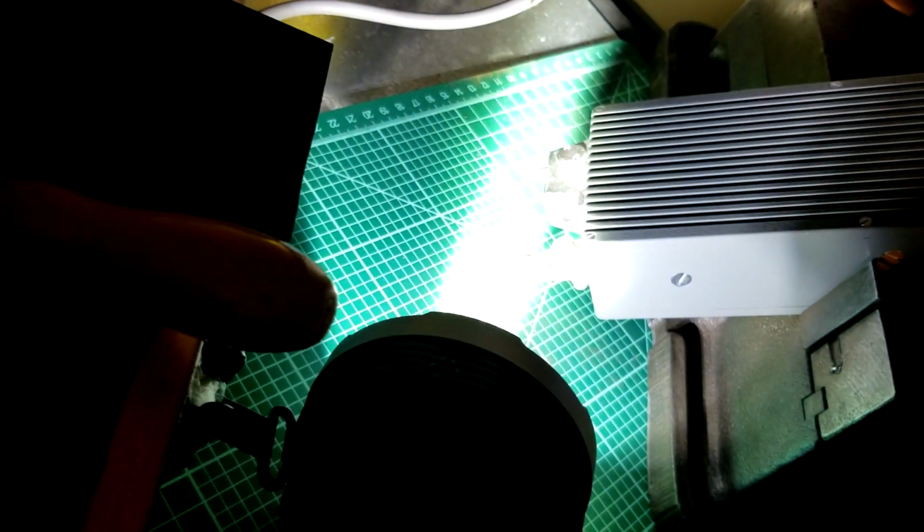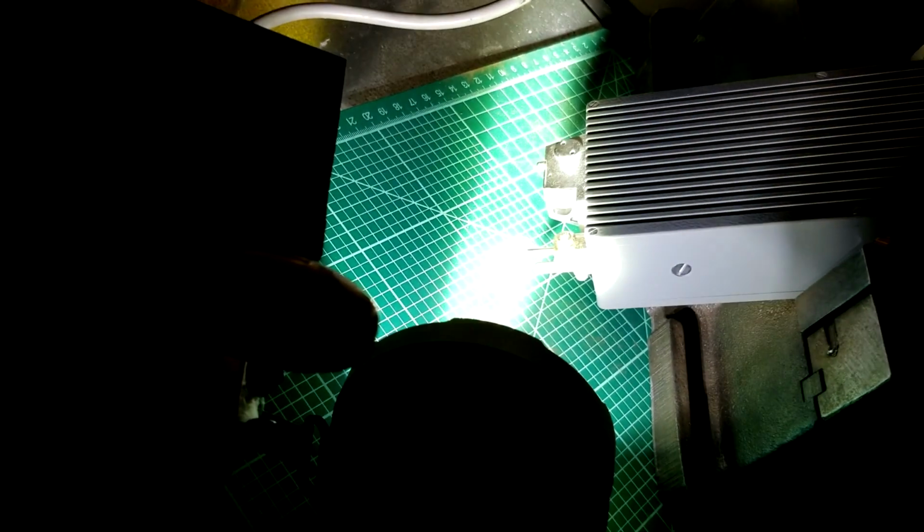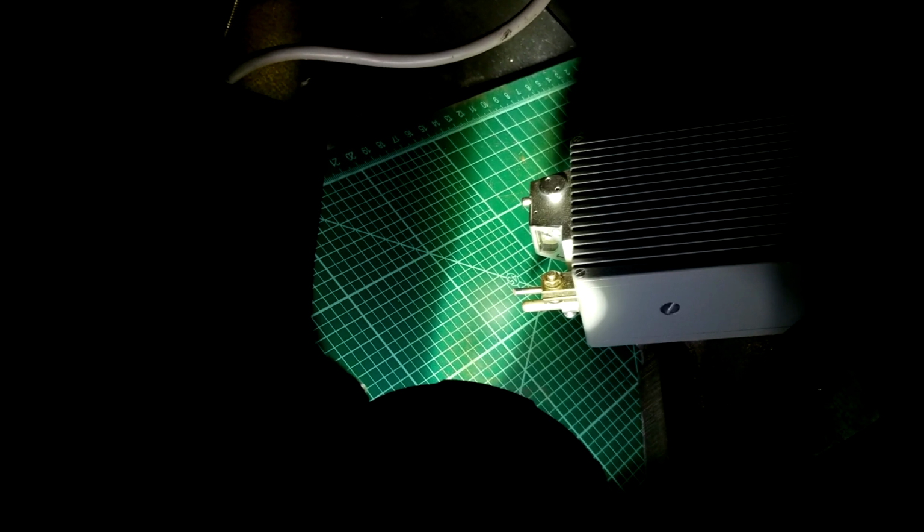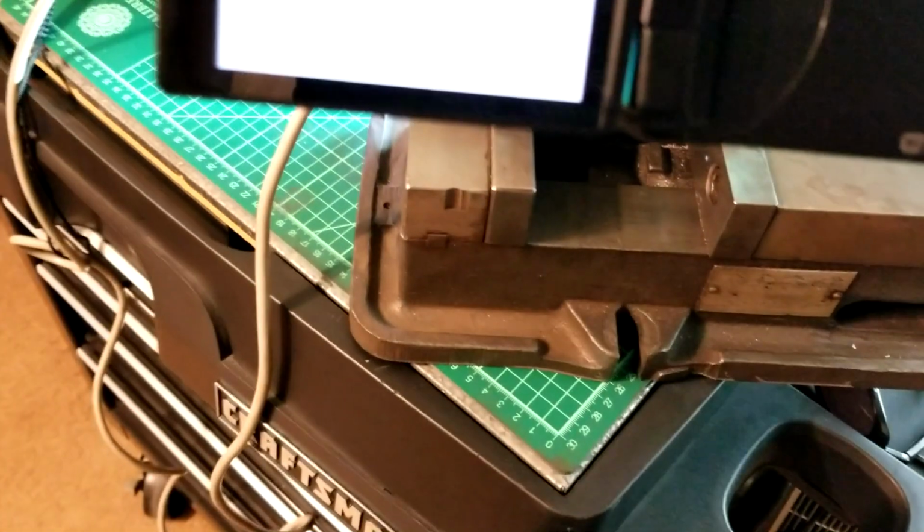I have a flashlight shining in the prism right now, which is extremely difficult to get orientated just right to shine in there. If I move this thing a 16th of an inch even, you won't see anything on the screen here. So anyways, it does work.